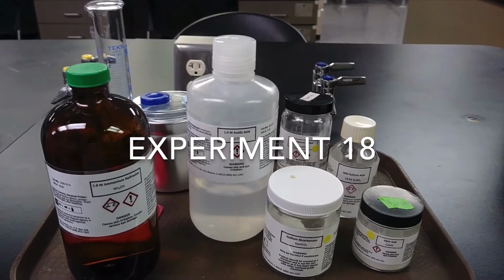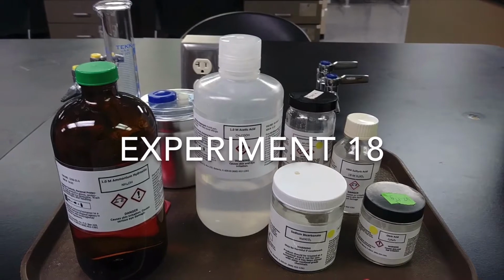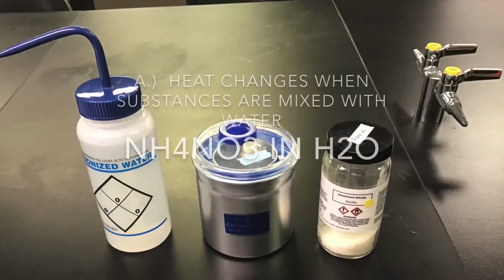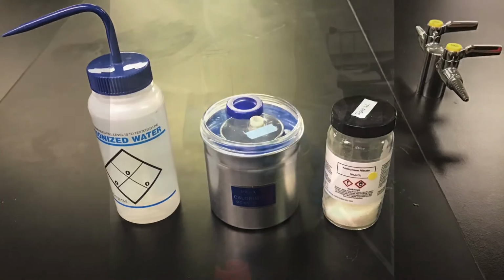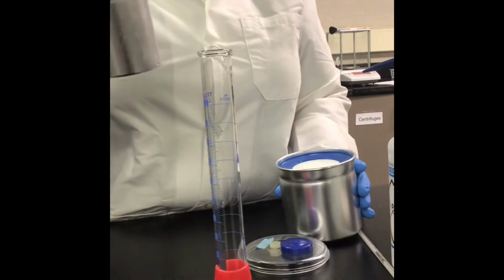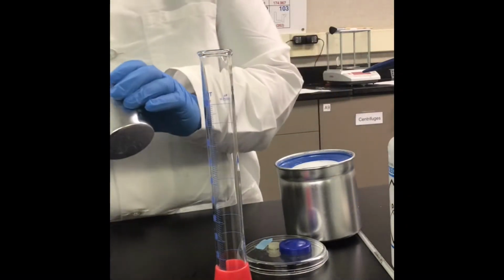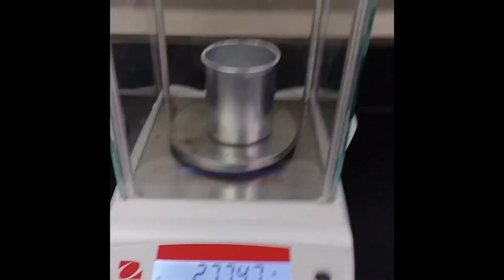Starting with Part A, heat changes when substances are mixed with water. We will measure the temperature changes that are associated with the dissolving of ammonium nitrate in water. Our first step is to get the mass of the calorimeter that we will use to conduct this experiment. Please pause the video and record the mass of the calorimeter on your report sheet.